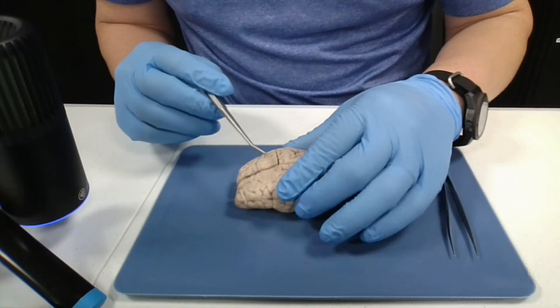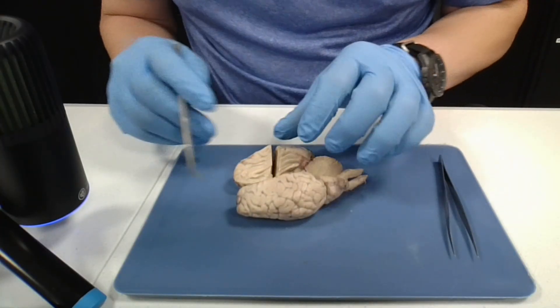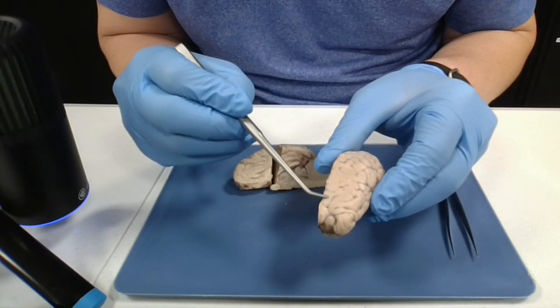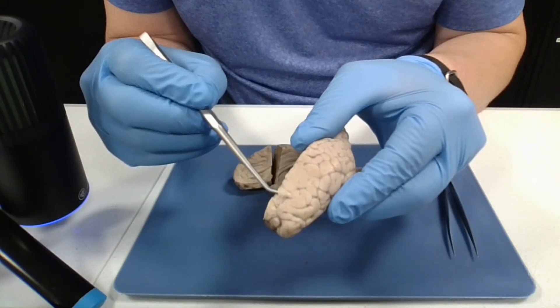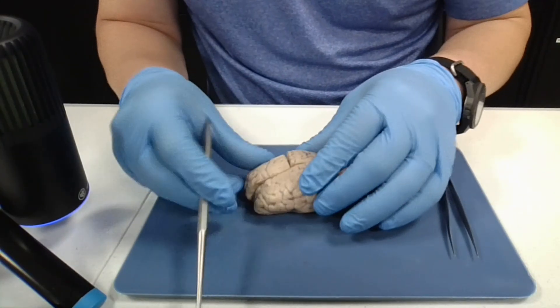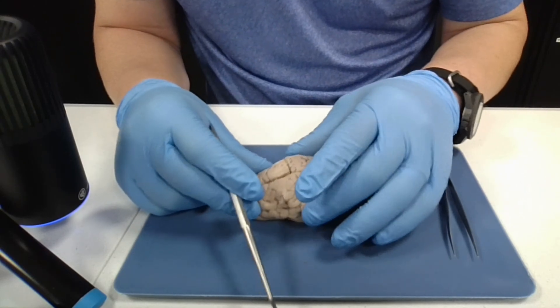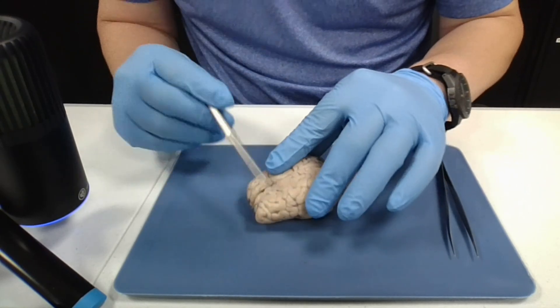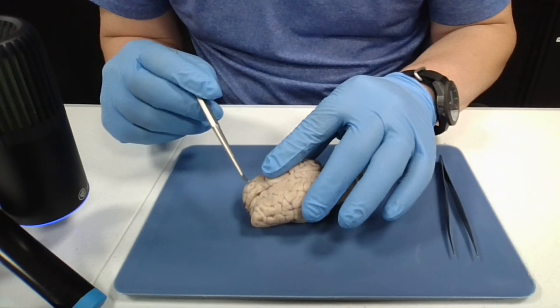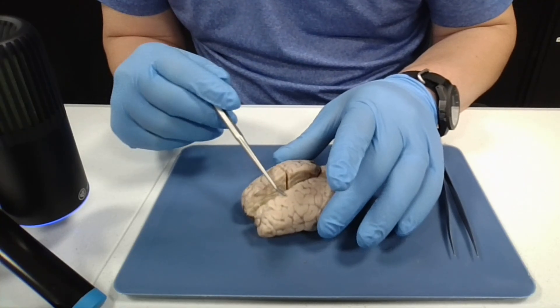On this specimen, the dura mater was kind of stripped away already. You can see a little bit, and get my probe underneath here — the arachnoid and pia mater. The dura mater stands for 'tough mother.' The arachnoid mater is called that because it's web-like, and the pia mater is thin, delicate, and plays a special role in the blood-brain barrier.